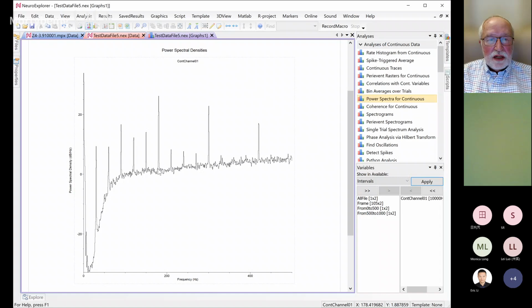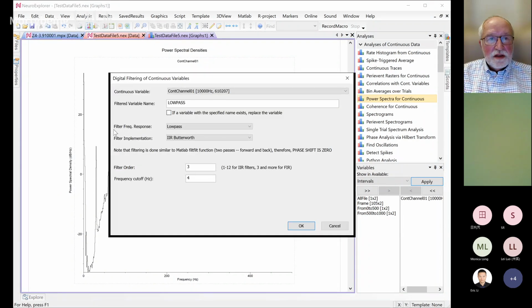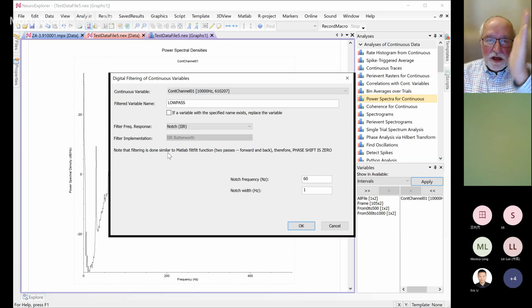So I'll just show you how to remove this peak, for example. To do this, you go to, again, the edit menu, digital filter, and in the frequency response, you select the last one, notch. A notch filter will cut the frequency that you don't want. So if you have 50 hertz, then you specify 50 here, but now we will do 180 hertz, and the variable will be called, I don't know, filtered.